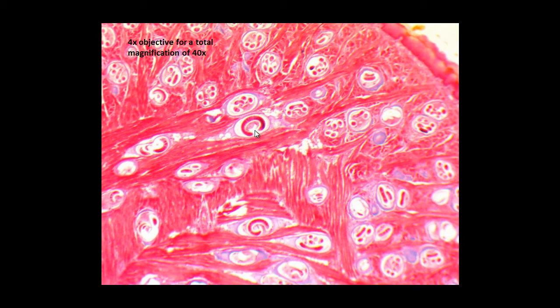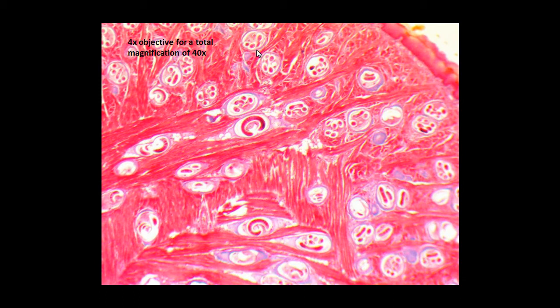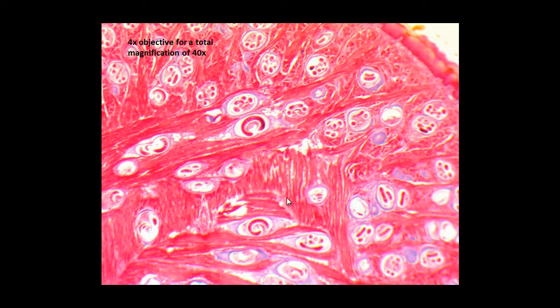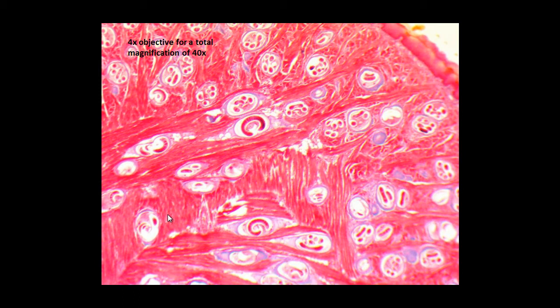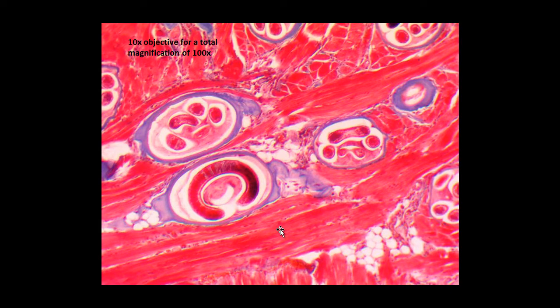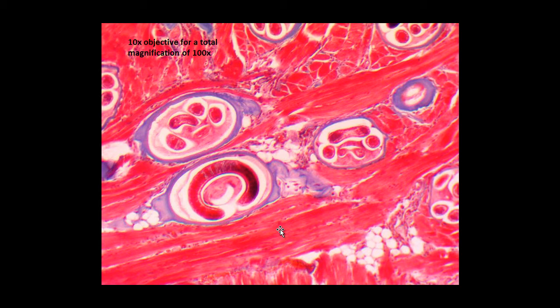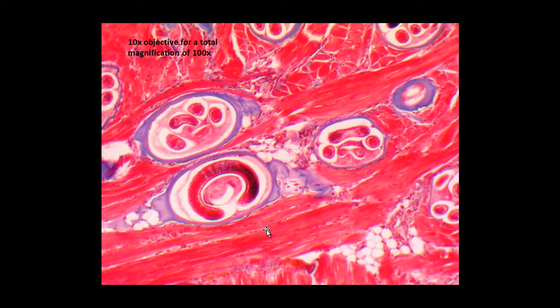Here we can see a series of cysts that each have a Trichinella larva, and we can see them interspersed within the muscle fibers of a diaphragm. When we increase the magnification by using the 10x objective for a total magnification of 100 times, we can now see the worms a little more clearly and start to differentiate some different parts of the various larvae.